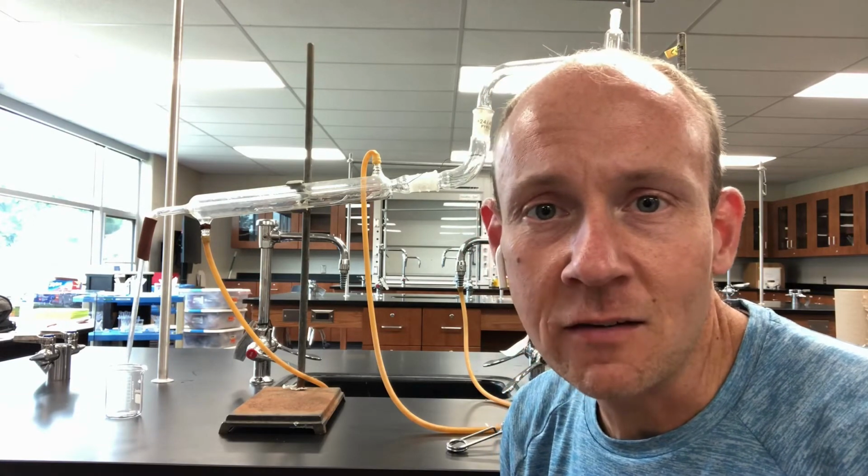make up the mixture. We saw that in a lab we could separate a mixture of sand, salt, iron, and gravel using some of the characteristics of the pieces, like the iron was magnetic, the gravel was big enough we could pick out, the salt dissolved in water, and so on. But another technique for separating a mixture when you have liquids involved is a distillation, and the property that comes into play is the boiling points. So we're separating liquids based on their different boiling points.